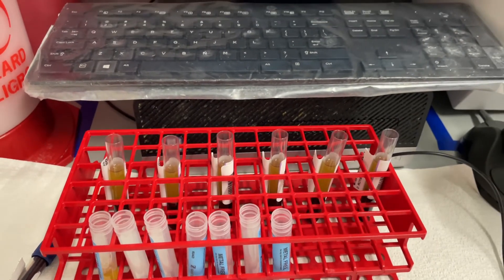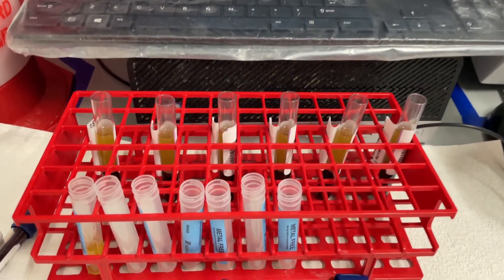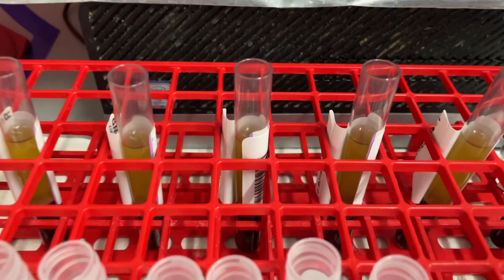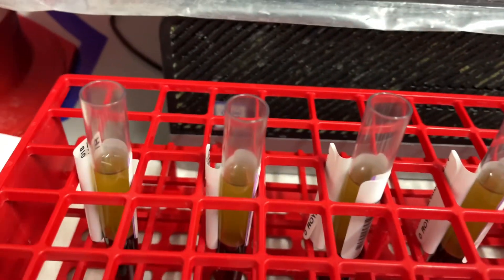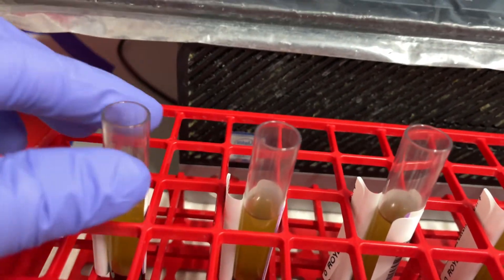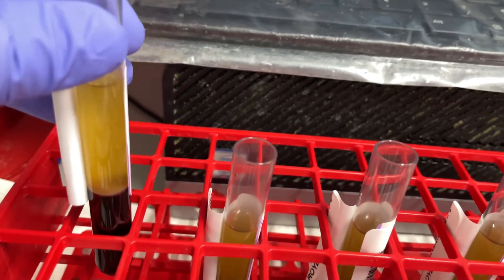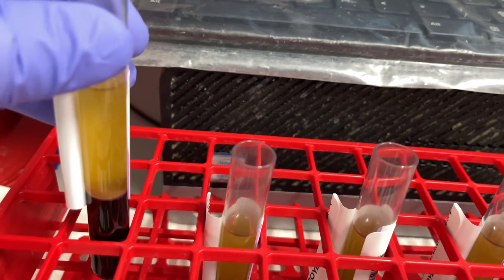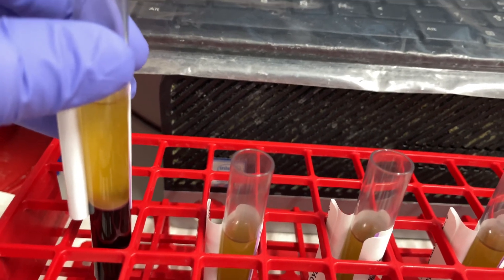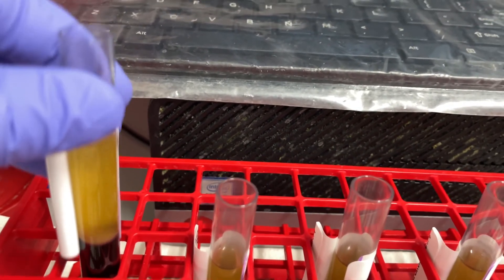After I take them out of the centrifuge, they will appear like this. Since there's no separator, you have to be very careful not to get those red blood cells mixed in.